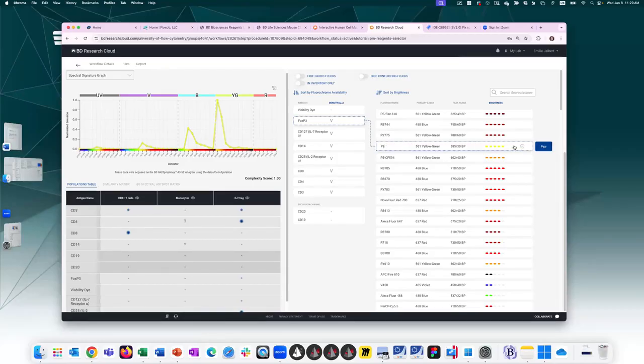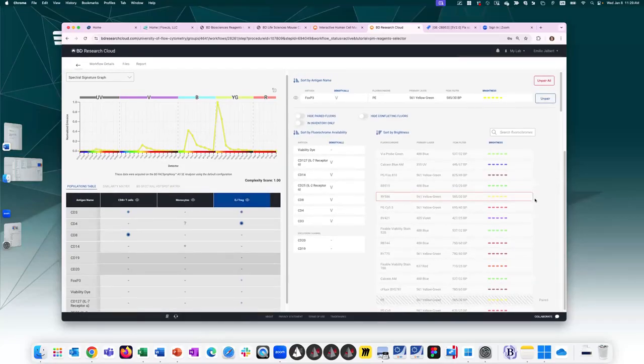inventory. I've filled out the BDRC inventory with the reagents that are available in my lab. I know that I've used this in the past. I like it. So I will go ahead and pair FOXP3 PE with this fluorochrome. By clicking the paired button, it moves the antigen out of this list and puts it up top here. And now the fluorochrome profile will become permanent on the spectrum viewer.